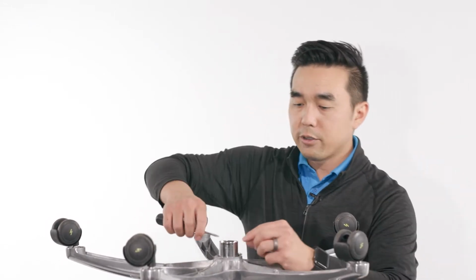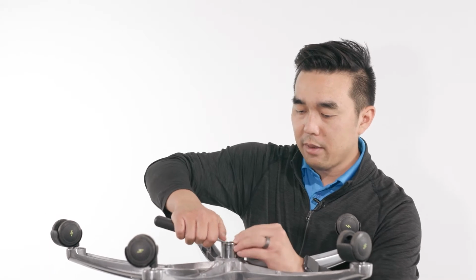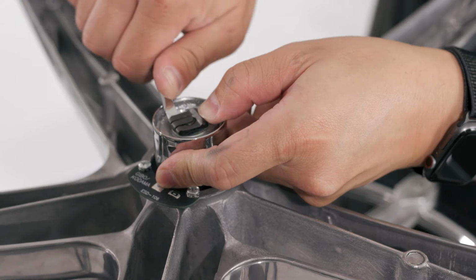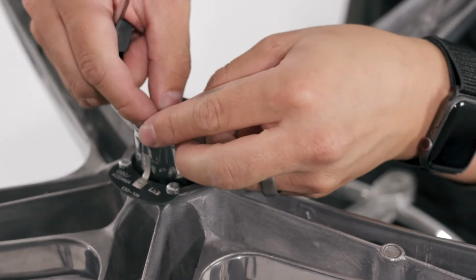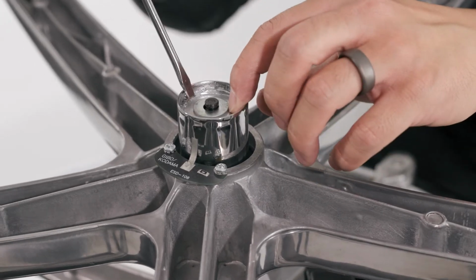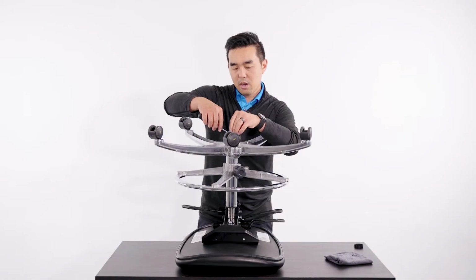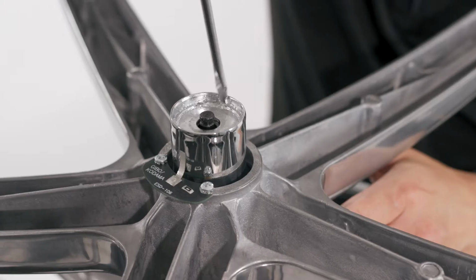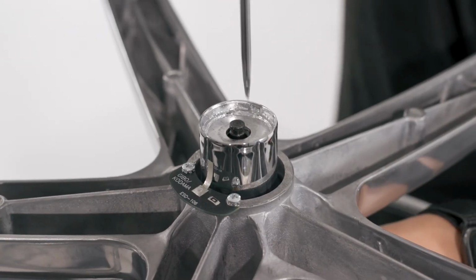We're going to take our flathead screwdriver and remove this locking clip, just like this. Make sure we don't lose any of these parts. This flat washer, set that aside. Now there's a washer right here on the inside. You can kind of see it right here.